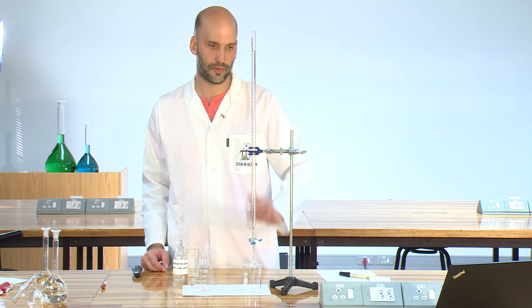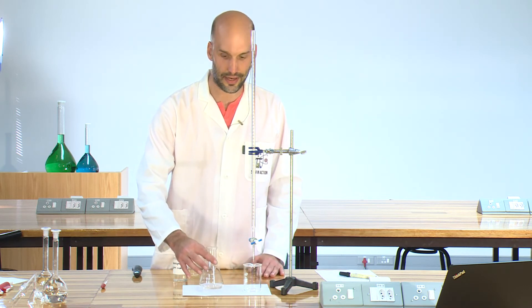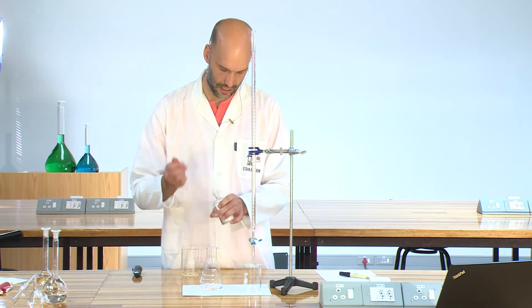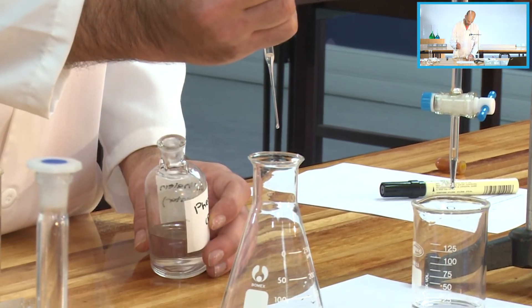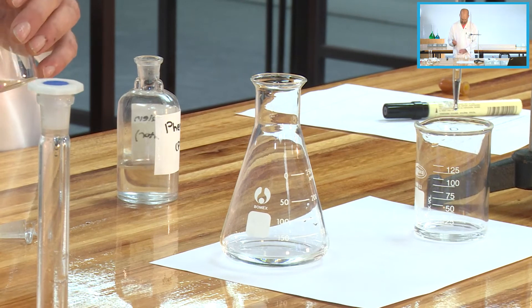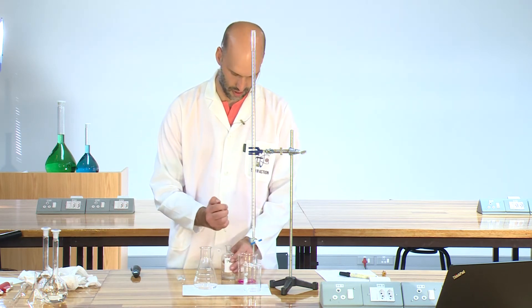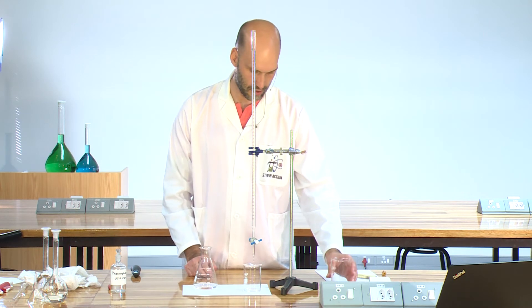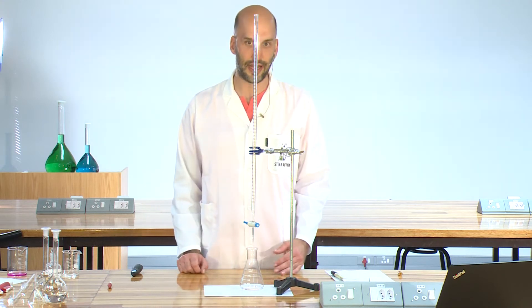As you will note, our sodium hydroxide is colorless, as is our oxalic acid. So how will we know when we reach our endpoint? For that we need an indicator. We are going to use our indicator - I am going to add just 2 drops with the Pasteur pipette into my oxalic acid. As you can see, when it enters the base, it turns a dark pink. Now our indicator is in and we can begin with the titration.